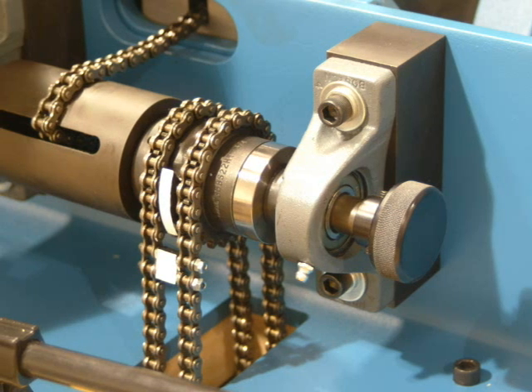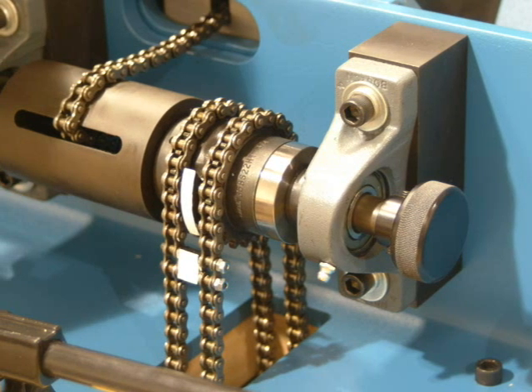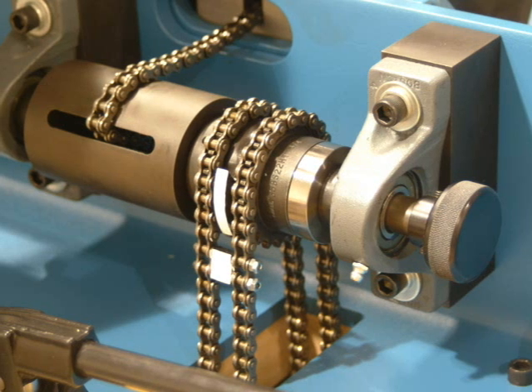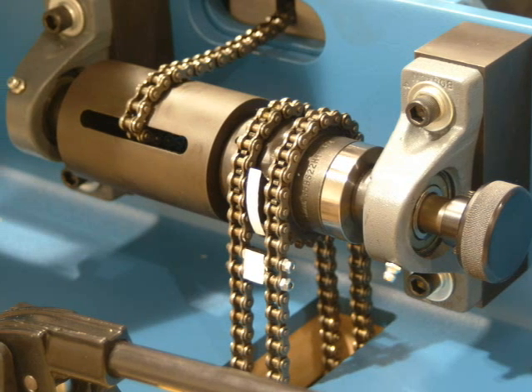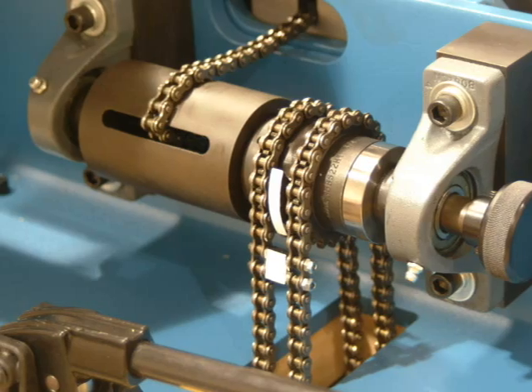For low speed measurements, the sliding anvil is moved by a chain pull driver. The speed of the anvil is controlled by using a variable speed motor to drive the chain. In this way, very low speeds can be acquired at a constant velocity.